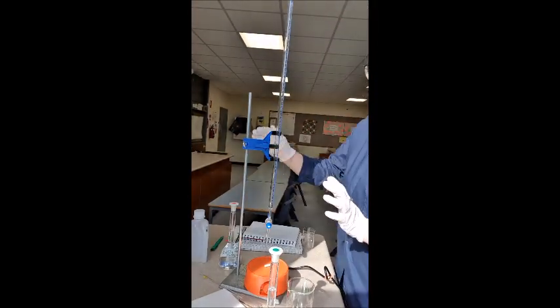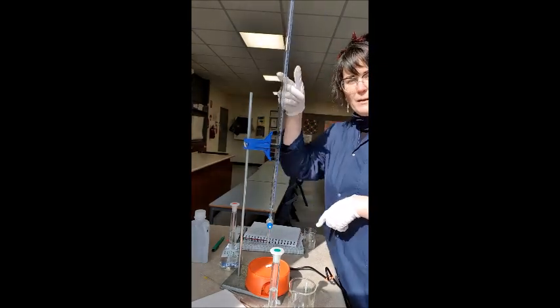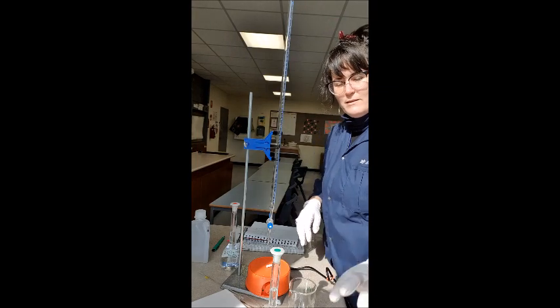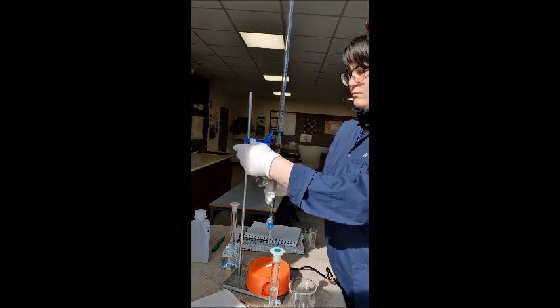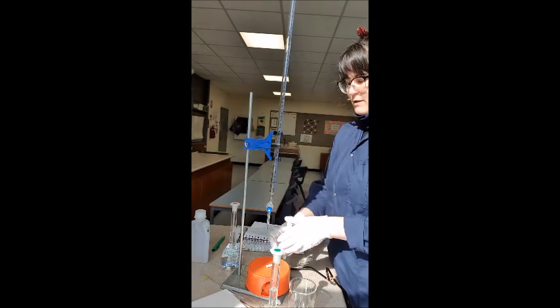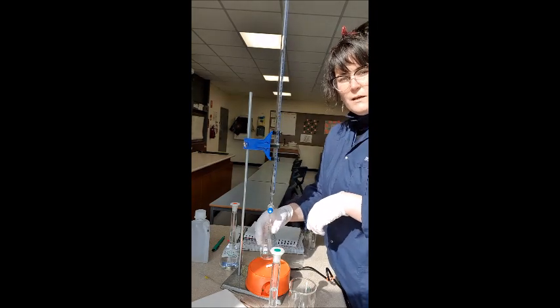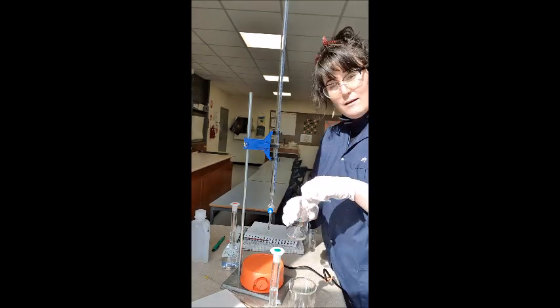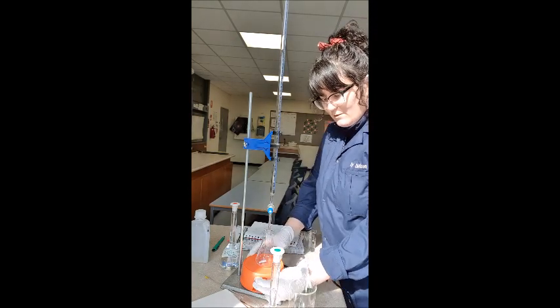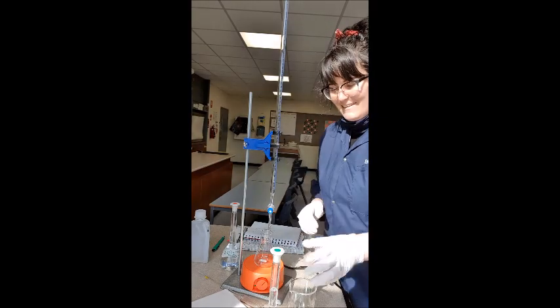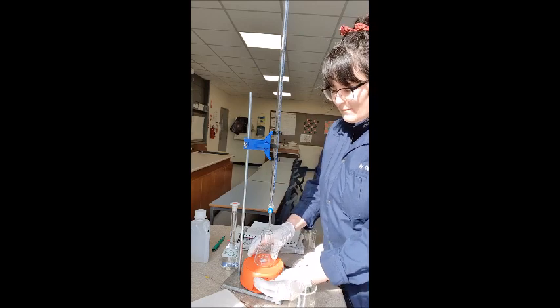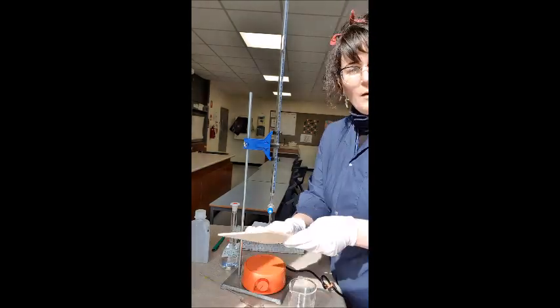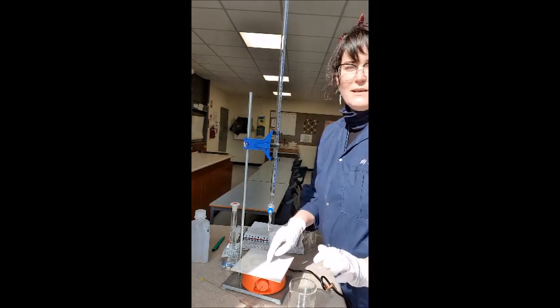Alrighty, so got my retort stand set up with my burette holder and my burette and down here I have a stirrer, magnetic stirrer, which is really cool. It basically, it's not necessary, but it basically means when I'm titrating, usually you have to continually swirl but with this I don't need to swirl so I don't have to worry about human error in that regard. I take this stirrer bead, which is magnetic, put it in my flask and put it on there and then when I turn this on, look at that, can you see how that's spinning? So it mixes it.